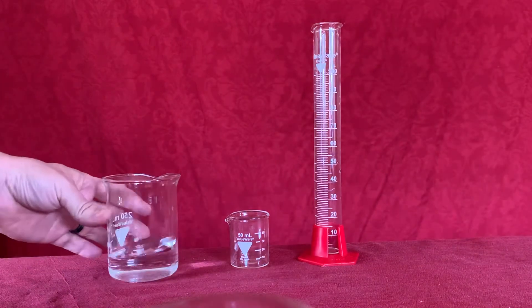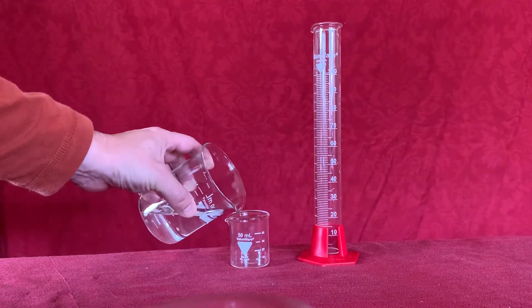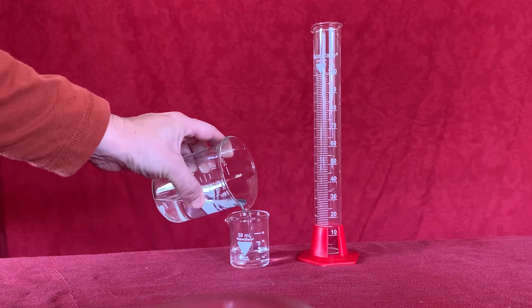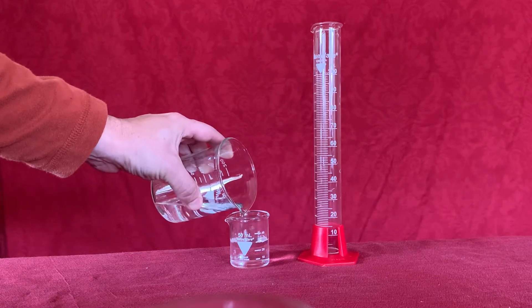I've got some water here in my 250 milliliter beaker. I'm going to pour roughly 30 milliliters into our 50 milliliter beaker, doing the best I can to get as close to 30 as possible.